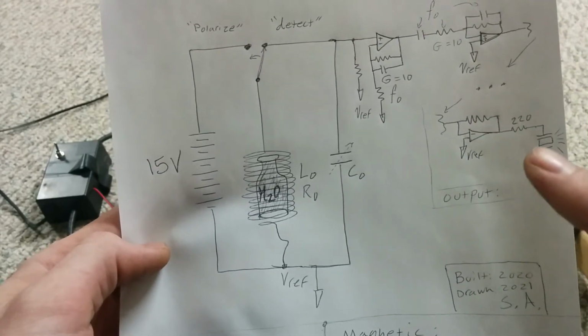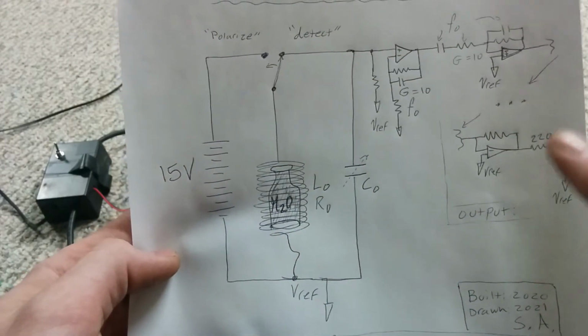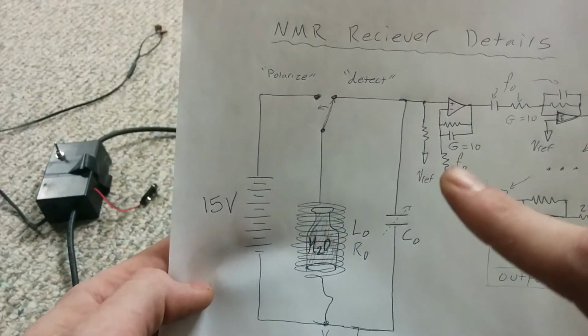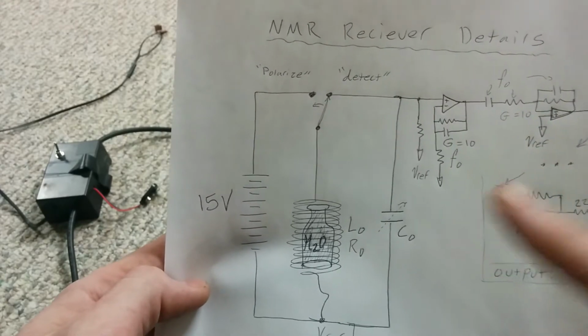And only one of those three options worked. One of the single endeds worked. The other two were unstable. They caused the amp to whine. And so I actually had to keep putting resistors across the ones here to get the gain up and up.